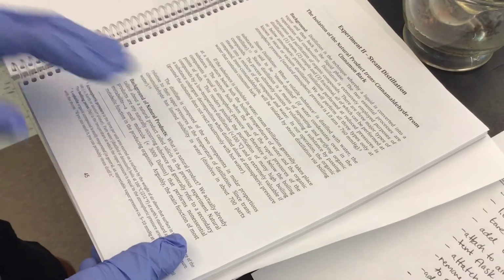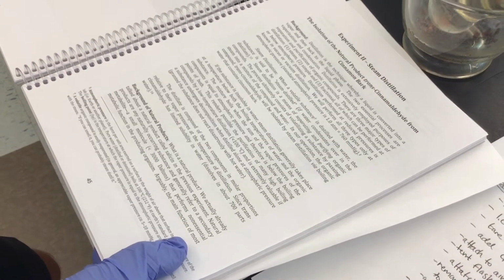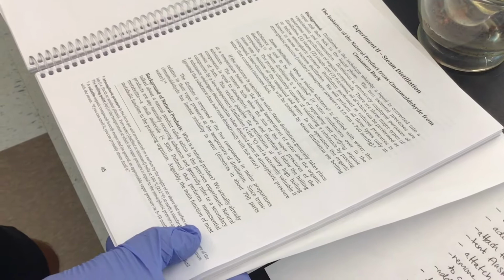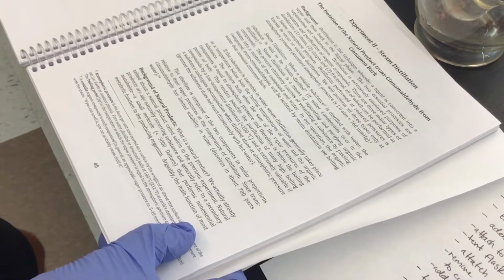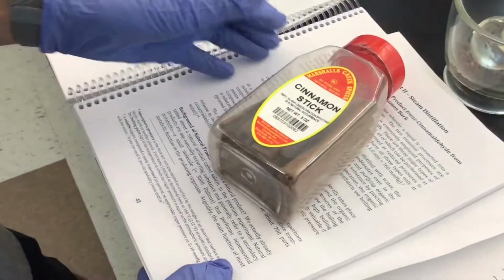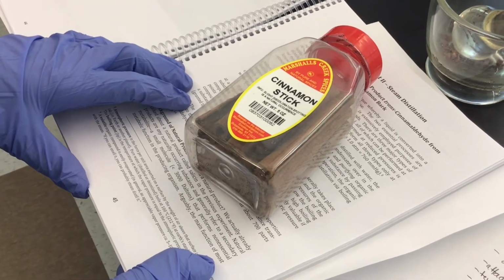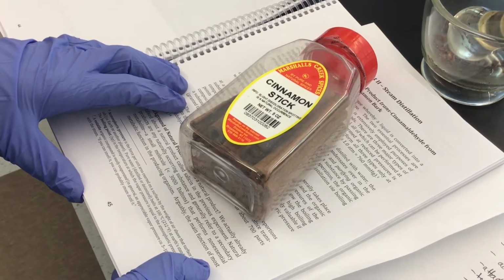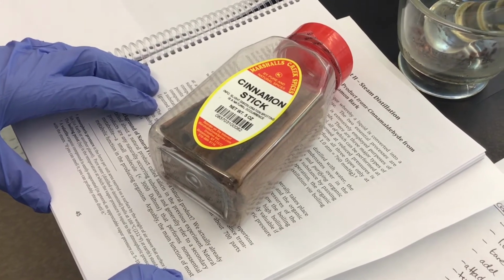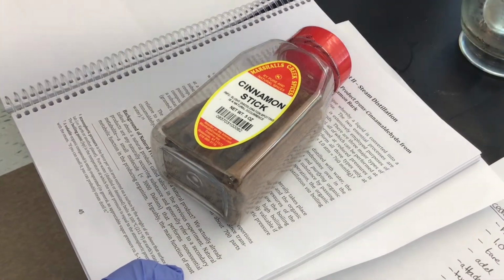Steam distillation is a very old process. In fact, it dates back to ancient Egypt, where it's been written that they were making perfumes via this very same method. Basically, if you've got a natural product like a flower, or in this case, a cinnamon stick, if you could smell something aromatic, it's likely that you might be able to steam distill it and isolate that essential oil, or the main component of the essential oil, and of course then later determine its structure, etc.